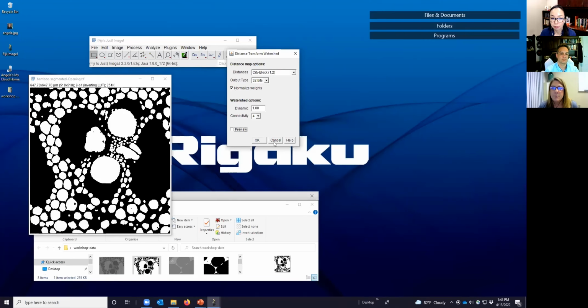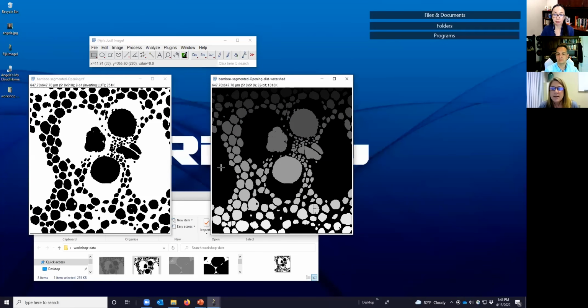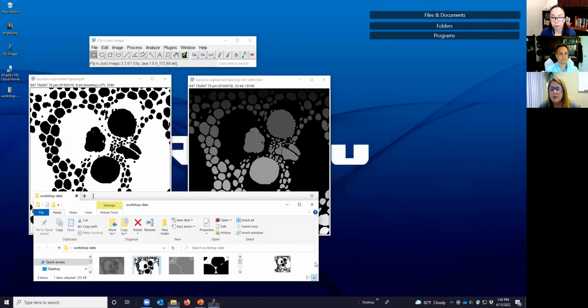And we're going to turn off preview, and we want to output our image. All right, so now we see the result of the distance transform plus watershed operation, and we could see it did a fairly good job, but there are some examples of over segmentation.